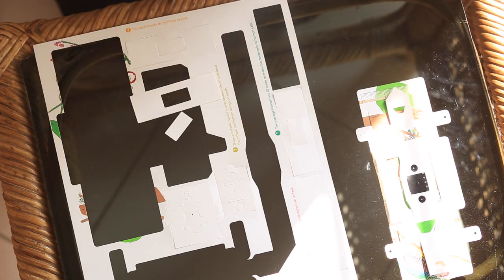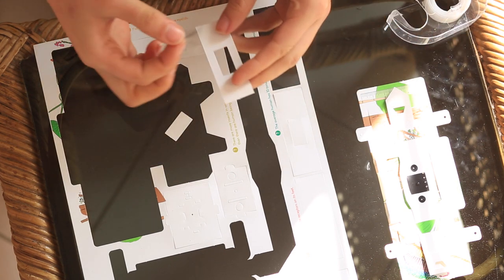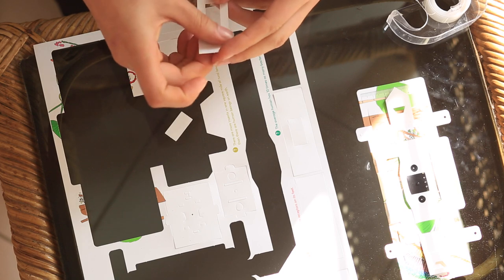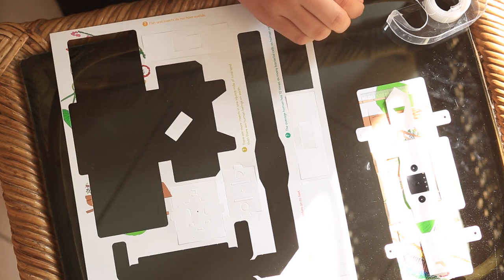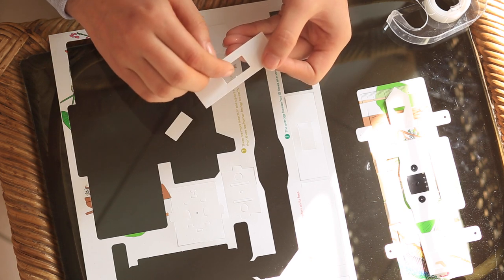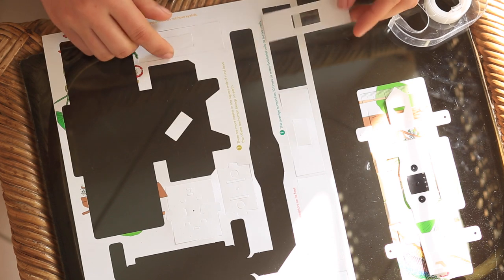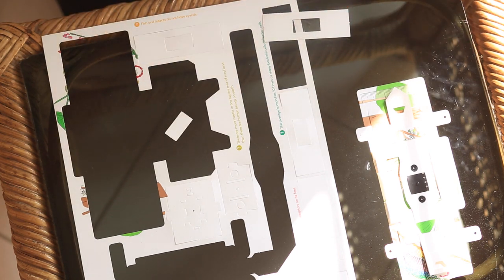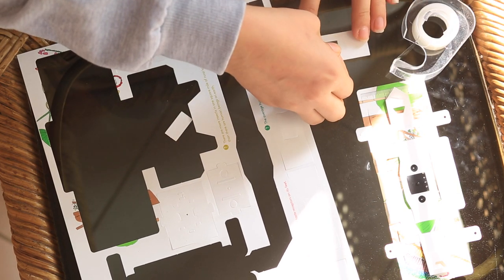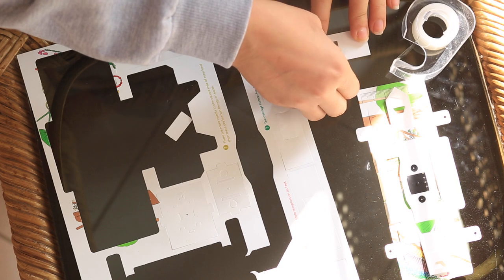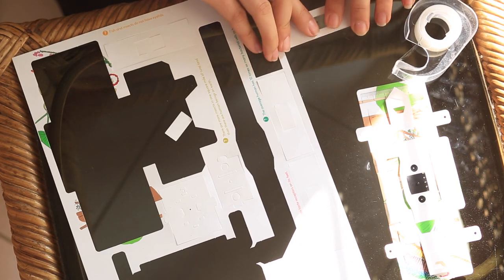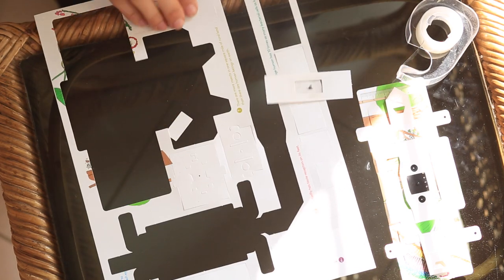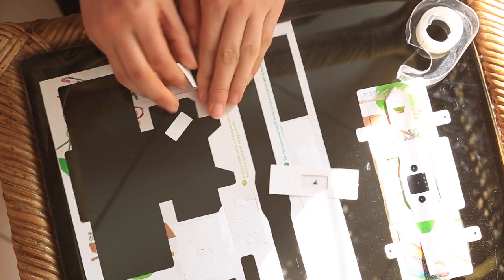You take cellophane tape. You put it on one side. You take your sample, which in this case is a small mosquito. Like that. Then you take another piece of tape and put it on top of it. Then you have your sample trapped inside of your piece of tape.